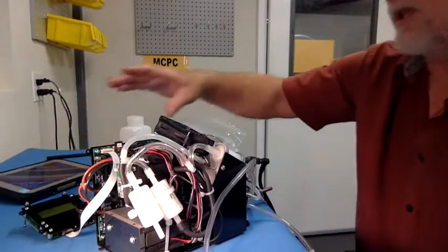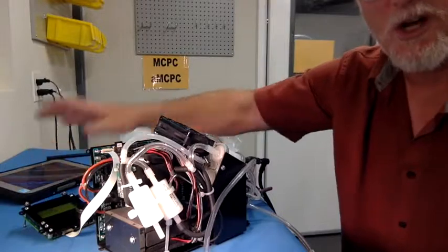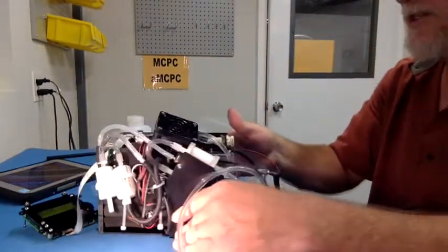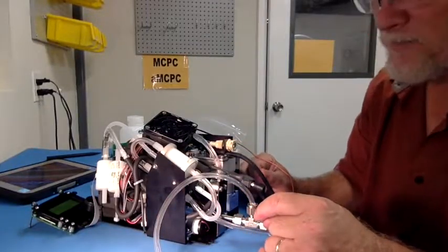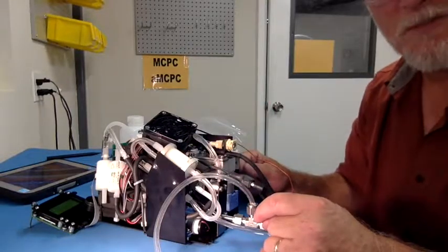Alright? I'll be talking in another video about the control software and using the control software. So that's pretty much the basics on how to set up the Mixing CPC and what the details are of the overall system.